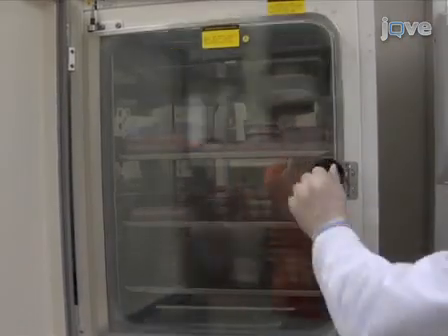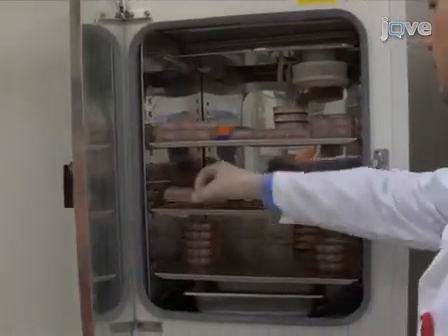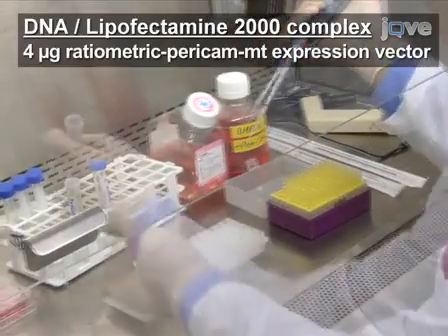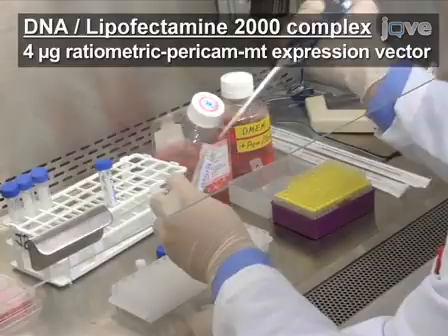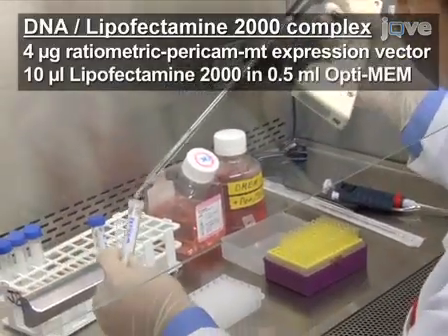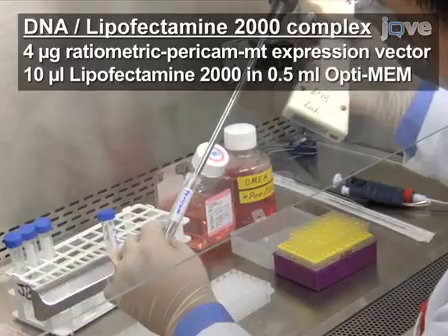The next day, prepare DNA lipofectamine 2000 complexes per the manufacturer's instructions with 4 micrograms of ratiometric pericam mitochondrial expression vector and 10 microliters of lipofectamine 2000 diluted in 0.5 milliliters of Optimem for each well to be transfected.